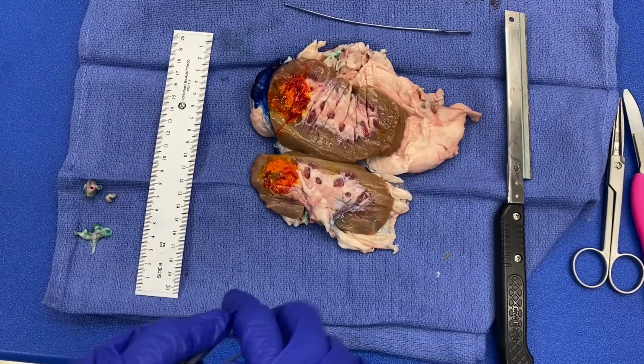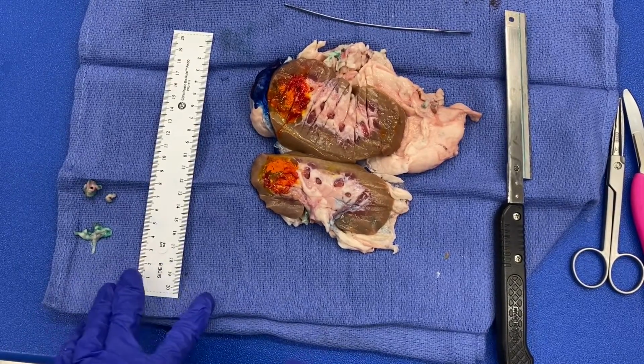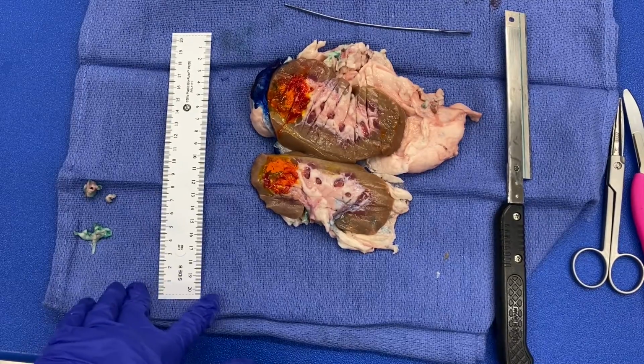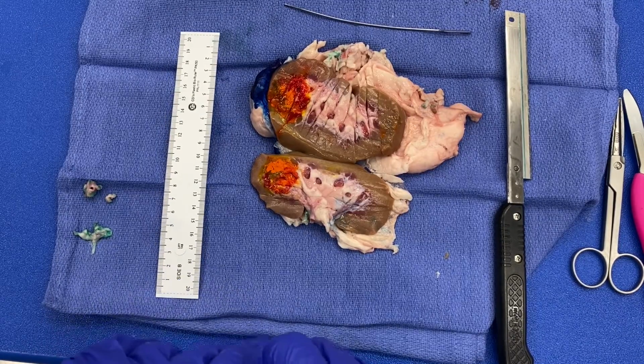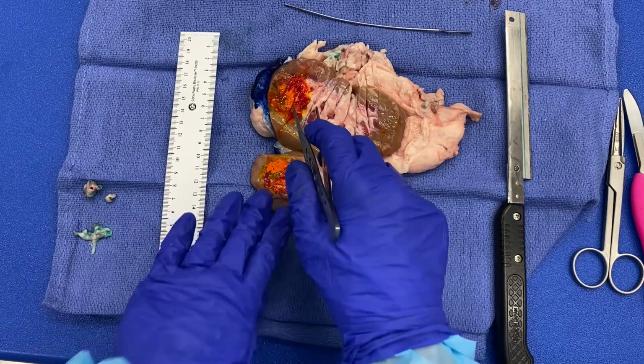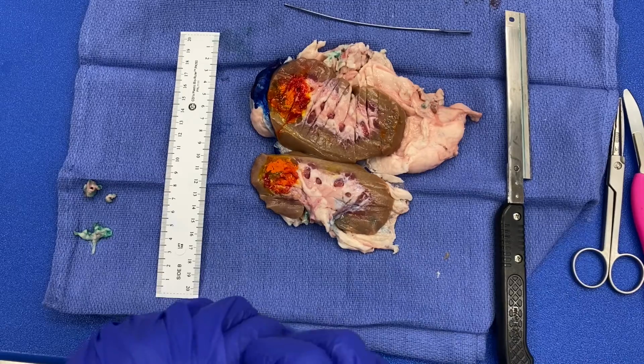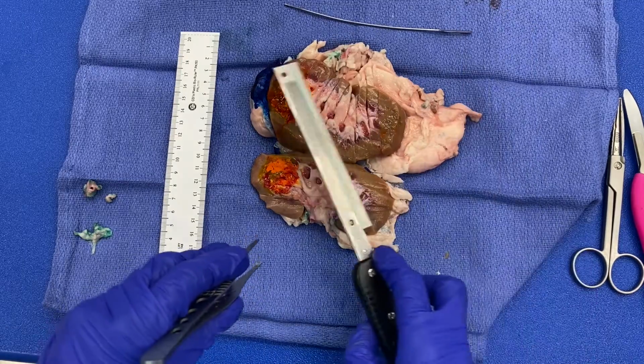Okay, now I have created a lesion in my superior pole. Remember that clear cell renal cell carcinoma has a very distinct yellow tan feature, and that's due to cytoplasm rich with glycogen and lipids. And they tend to be in the superior pole, which is what I have done here. So the next thing you'll do typically is fix your specimen, and you can do that after sectioning.